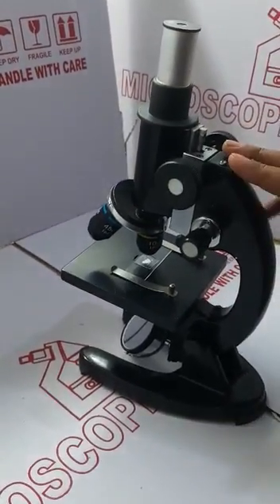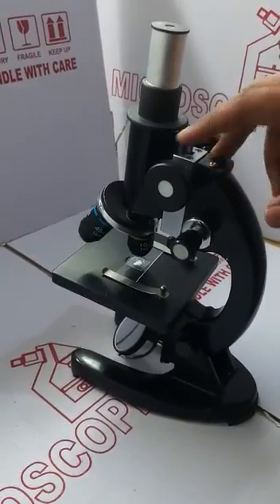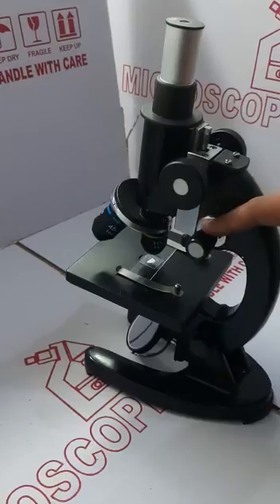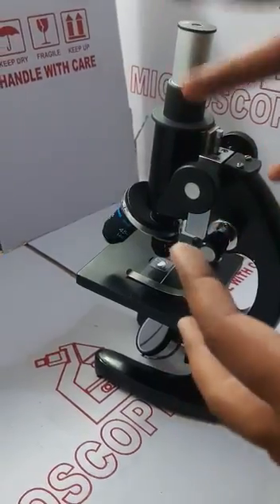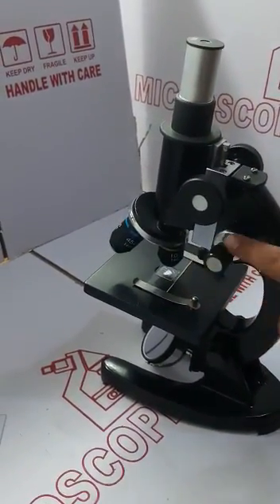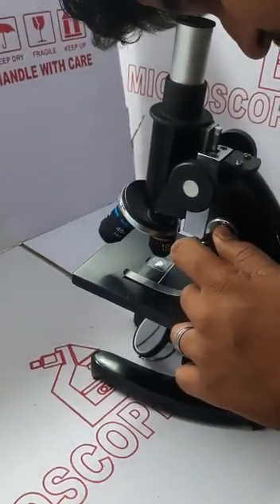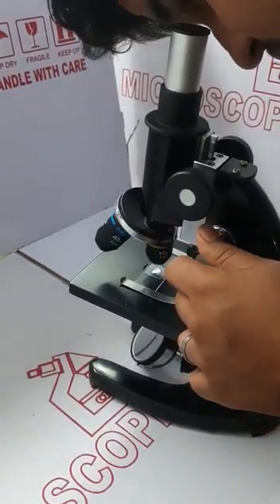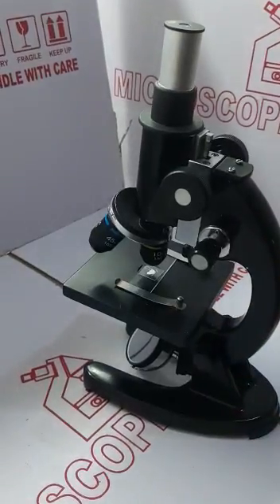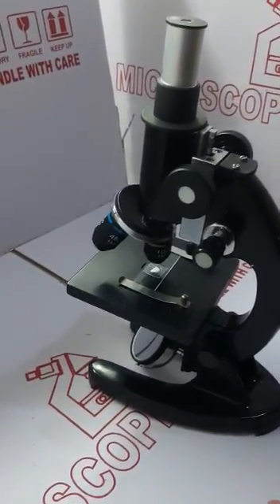This is where I can see an image of my sample by using the coarse motion, and I will just clear out the image by using the fine motion. I can now see the proper image of the sample. So this is how you create a sample. Thank you.